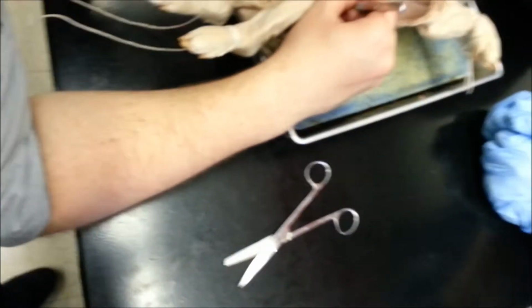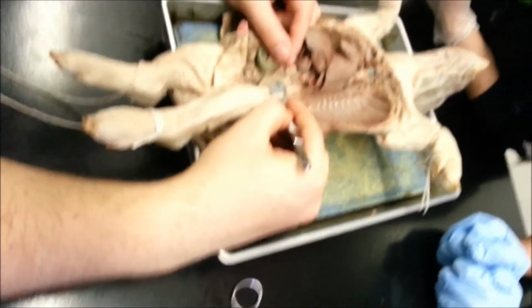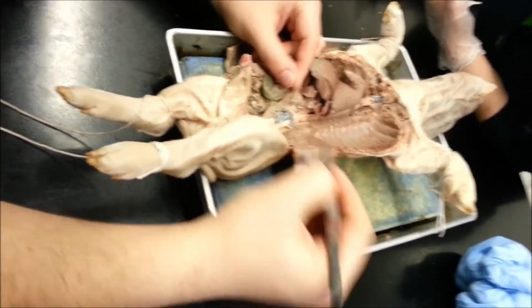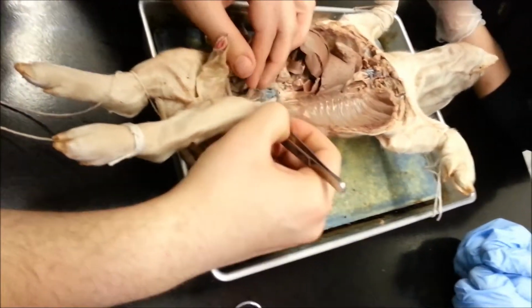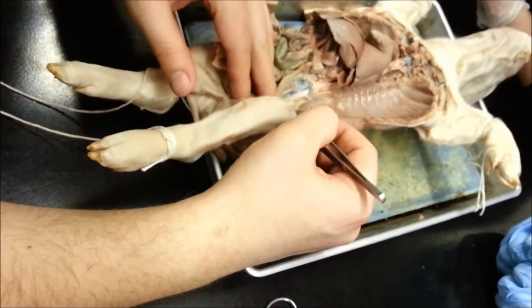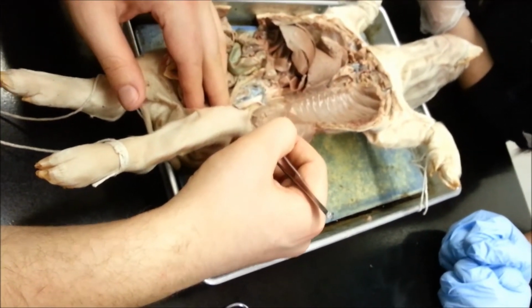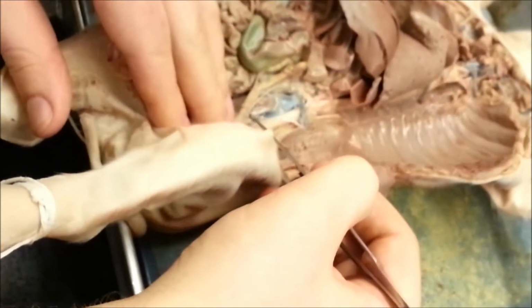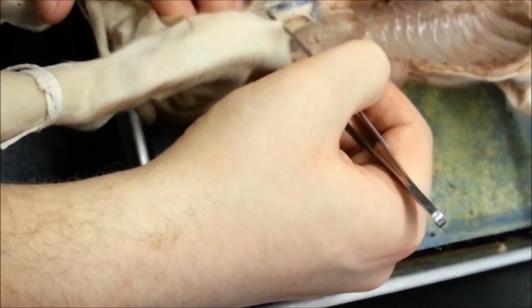All right, the next branch that we need to know is going to be the renal artery, and as you can see, that goes to the kidneys. Now, the next two are particularly small. I have a female here, so the ovary that I'm pulling on, as you can see, is very thin. This artery here is going to be the utero-ovarian artery. In the male, it's called the spermatics.